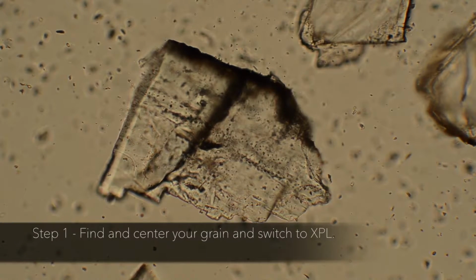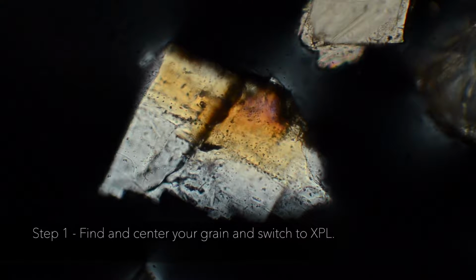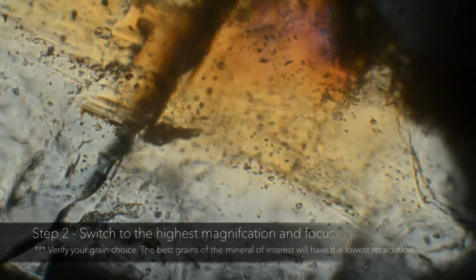Step 1. Find and center your grain. Switch to cross-polarized light. Step 2. Switch to the highest magnification and focus. Verify your grain choice. The best grains of the mineral of interest will have the lowest retardation.